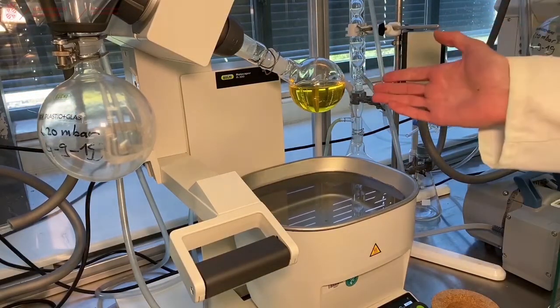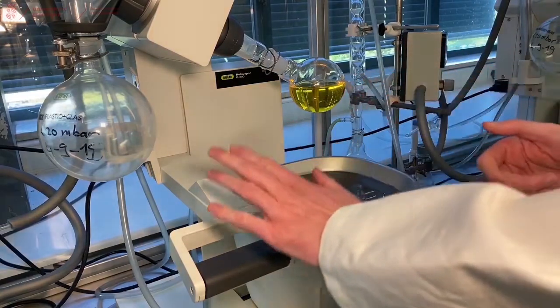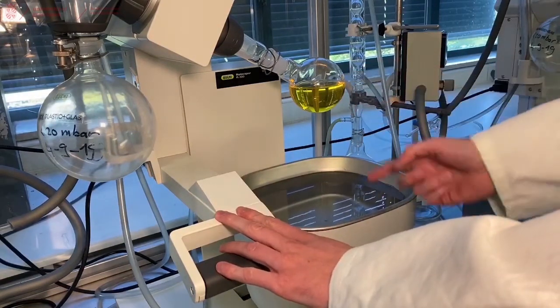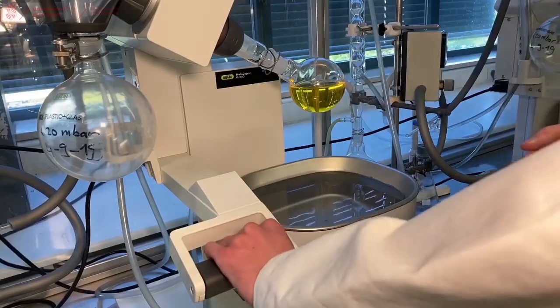Now that our flask is attached to the Rotary Evaporator, we can lower the Rotary Evaporator so that the flask hits the water and turn on the turning of the Rotary Evaporator.